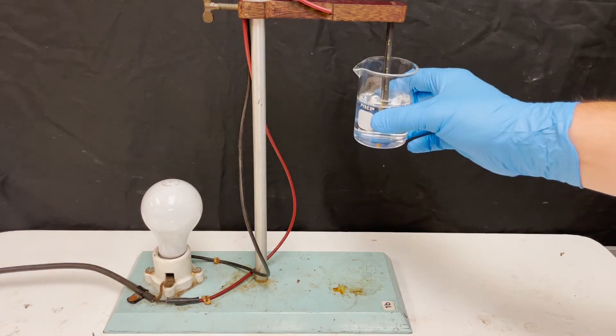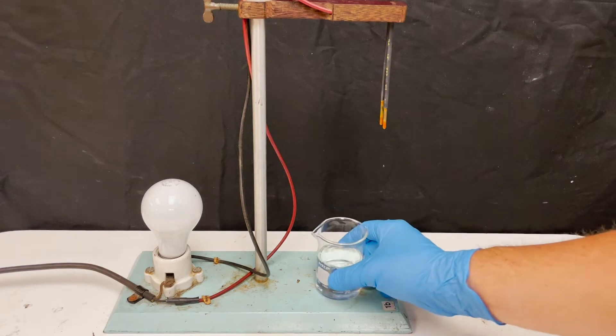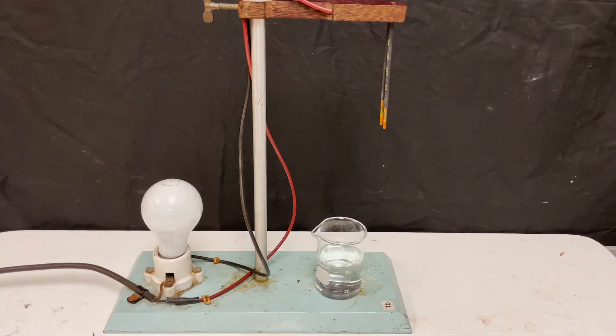This beaker contains distilled water. When I test it using a conductivity apparatus, nothing happens because distilled water does not conduct electricity.